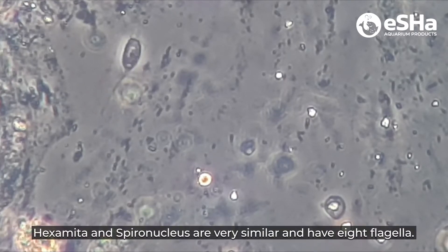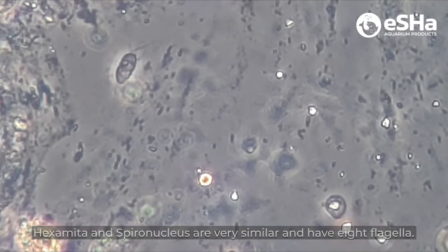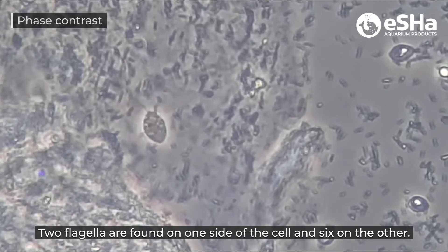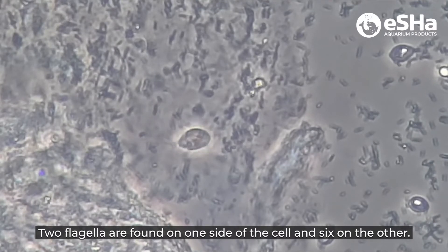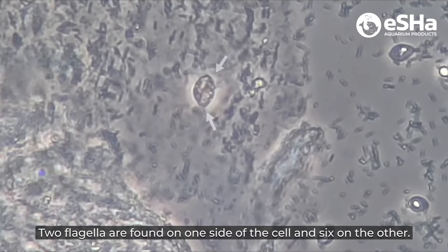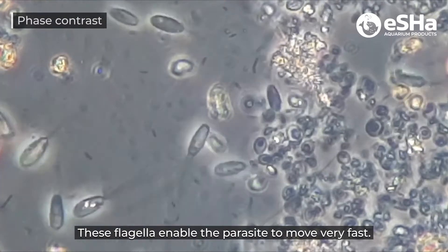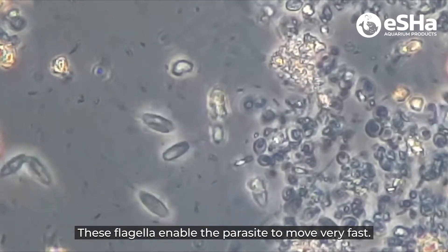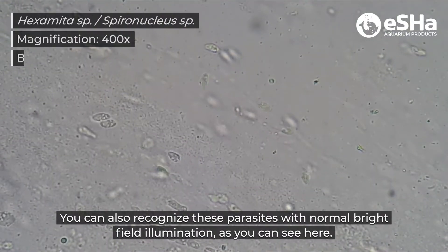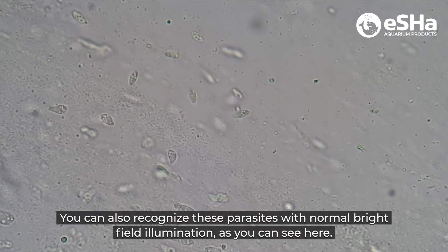Hexamita and Spironucleus are very similar and have eight flagella. Two flagella are found on one side of the cell and six on the other. These flagella enable the parasite to move very fast. You can also recognize these parasites with normal bright field illumination, as you can see here.